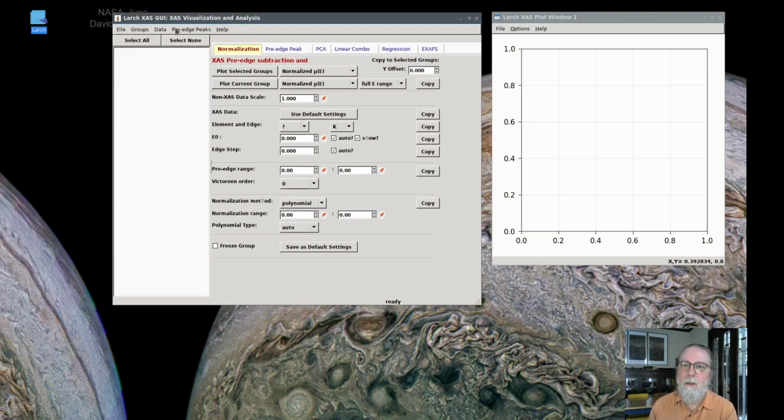I should say that there is one commonly needed correction that is not currently covered by the XAFS Viewer application, and that is applying dead time corrections to fluorescence data measured with multi-element solid-state detectors that do pulse processing. These are commonly used detectors, but there isn't a uniform way to express the dead time corrections in a way that can be easily imported and used by a GUI form.